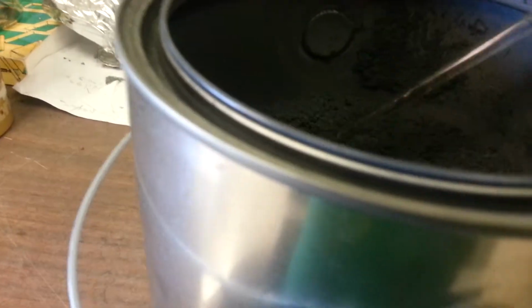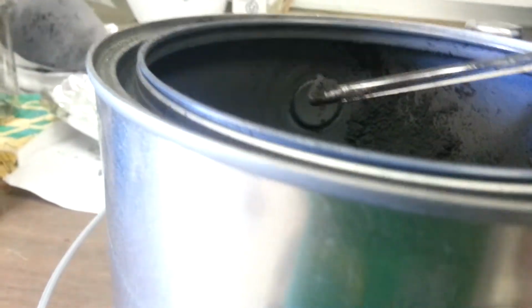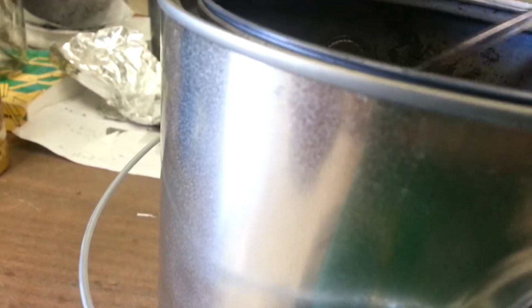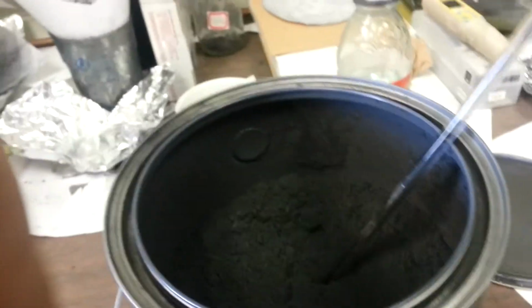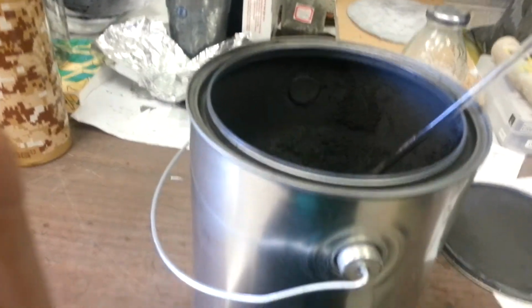It just comes out like that, and then it just falls off, and then it sticks to the little rod because it is what it is. I mean, it'll stick to anything, I'm telling you. It's actually hard to work with material. Not hard as in, oh, I know how to work with materials and whatever. But if you are a novice and you get this on stuff, here you go.